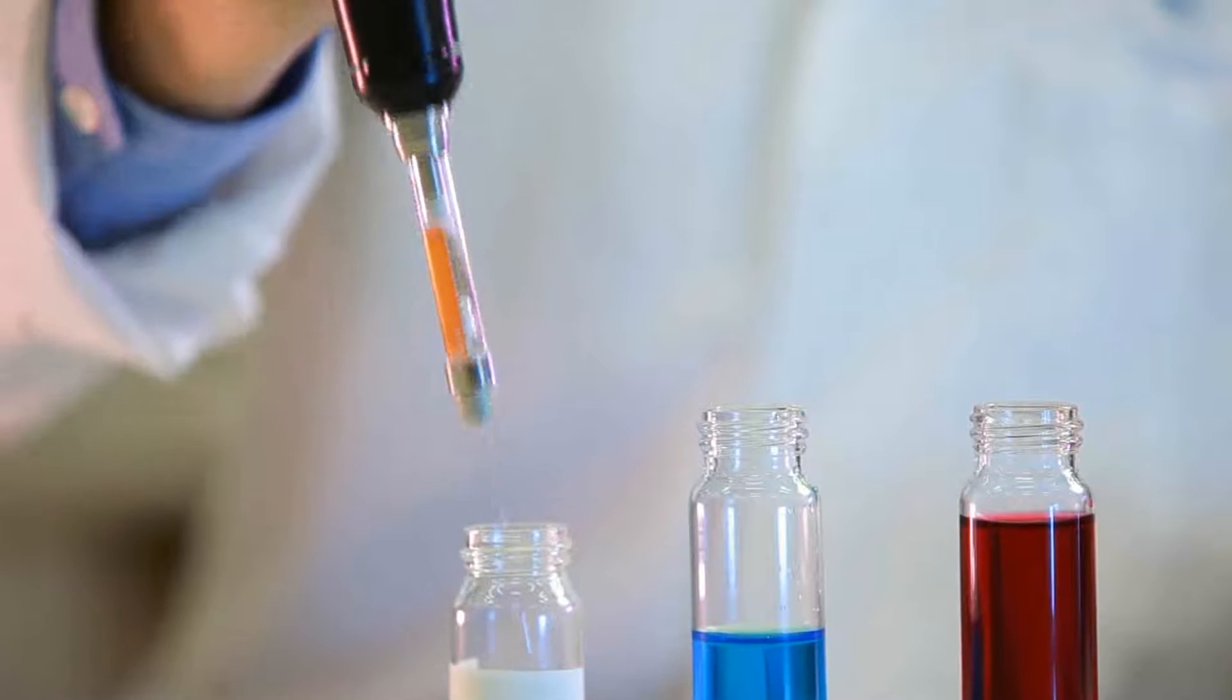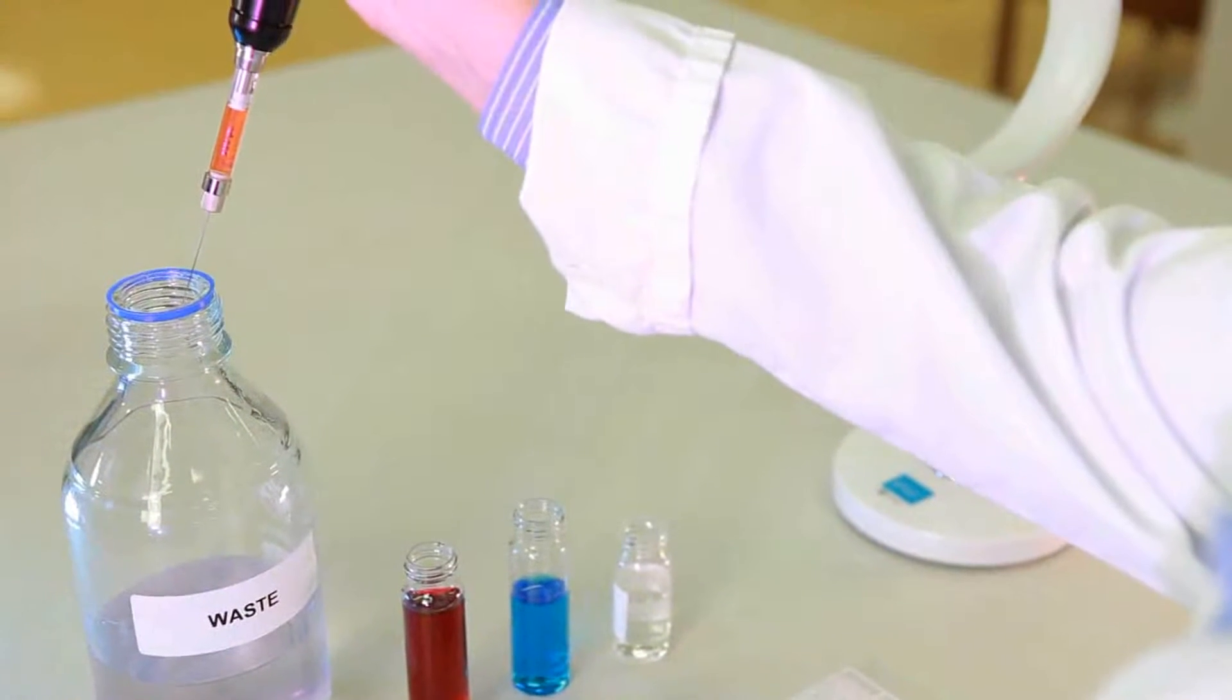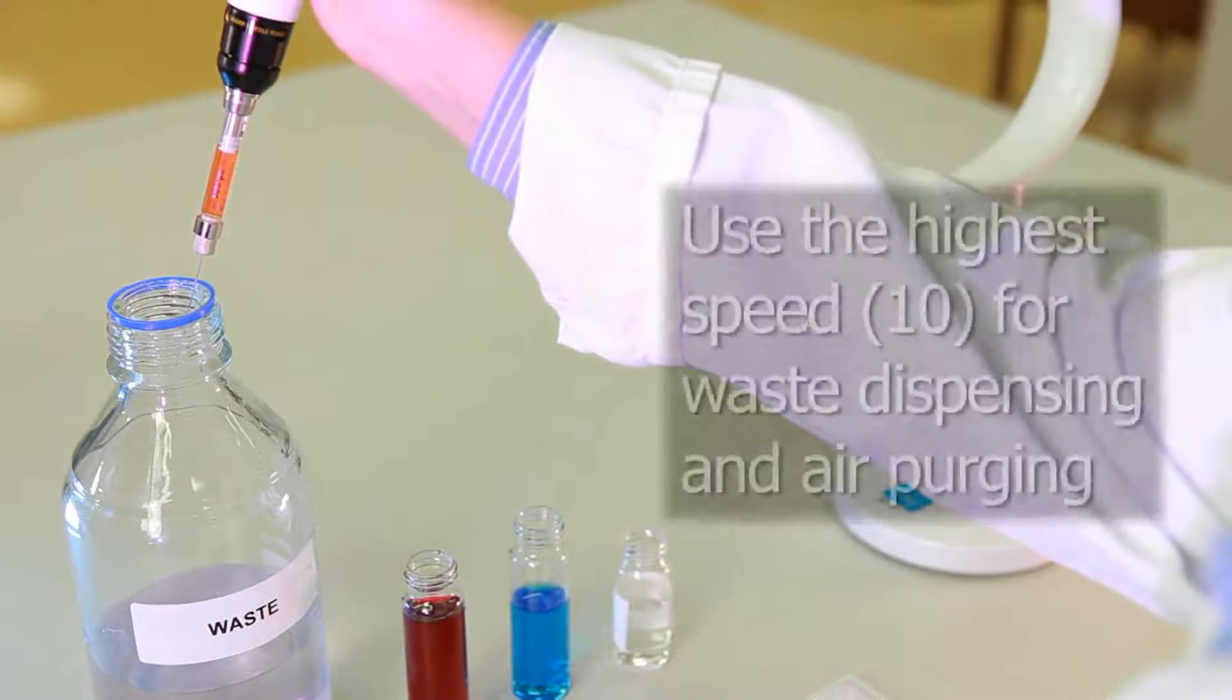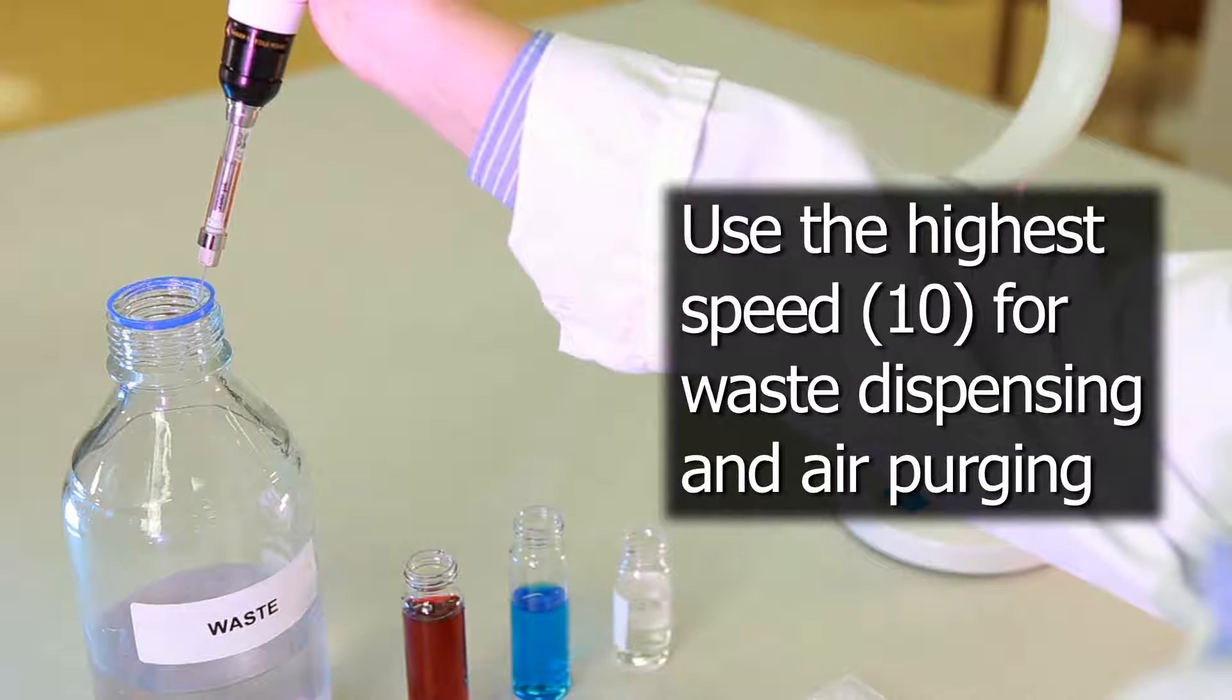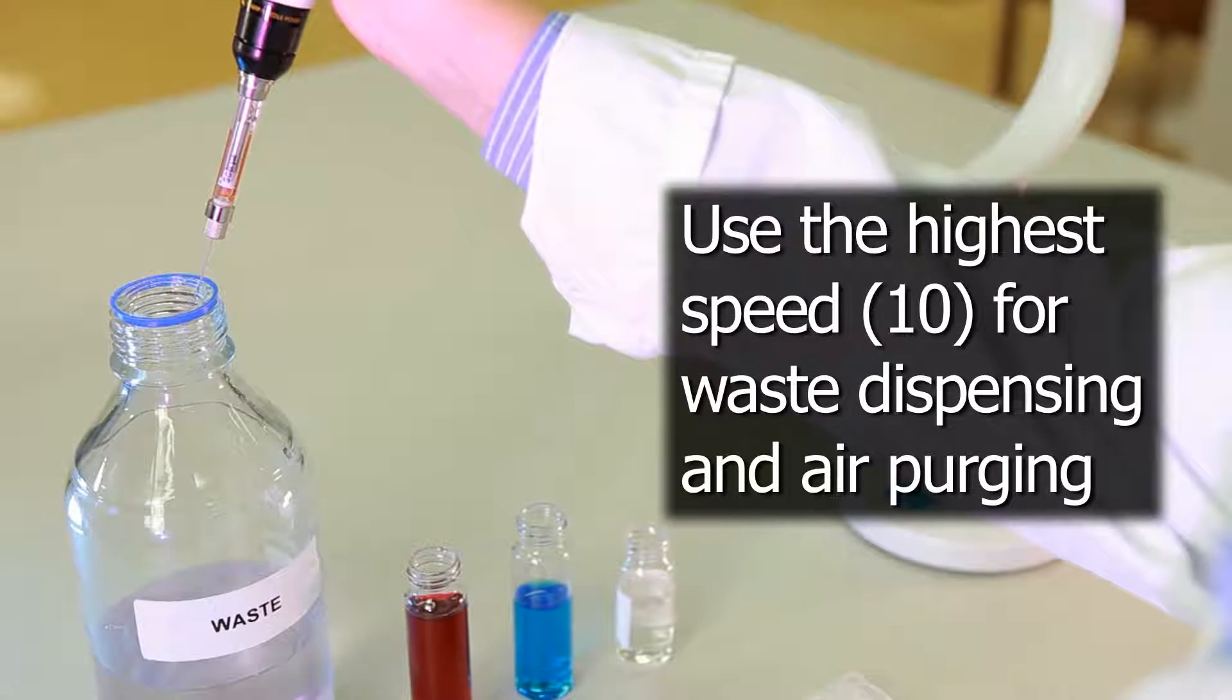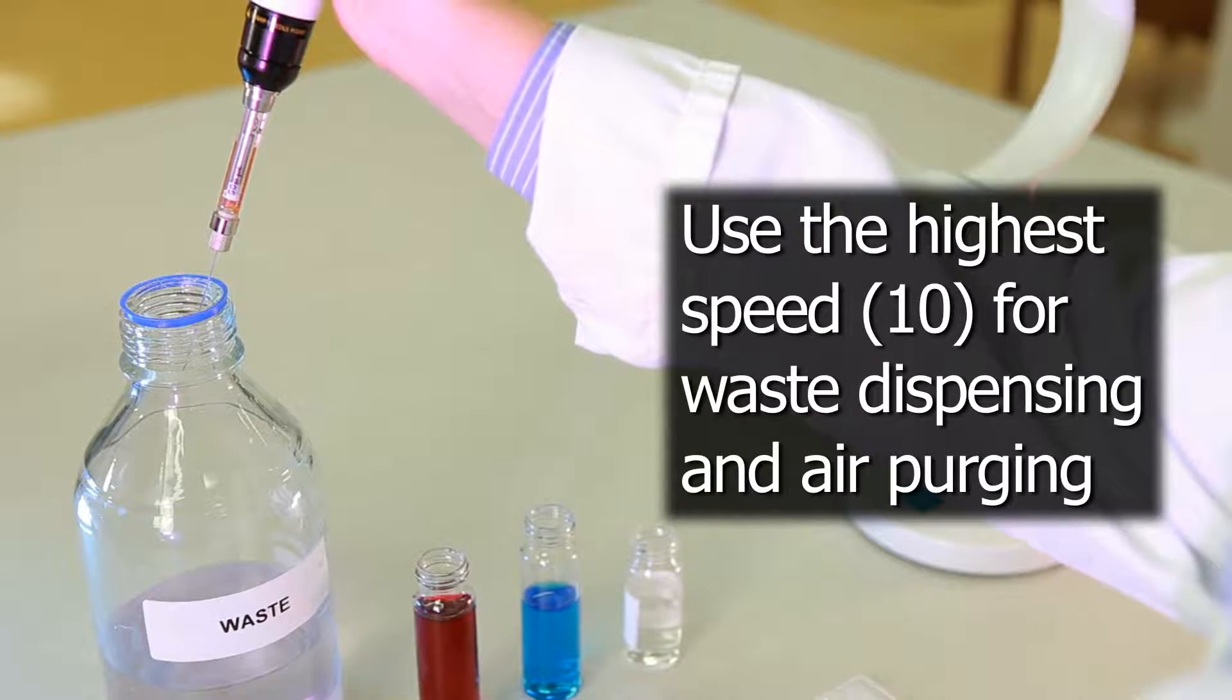Now, it's time to change solutions. To clean the syringe between solutions, Catherine washes the syringe once with 500 microliters of water and then once with an air purge. The syringe is then ready for transferring the new liquid.